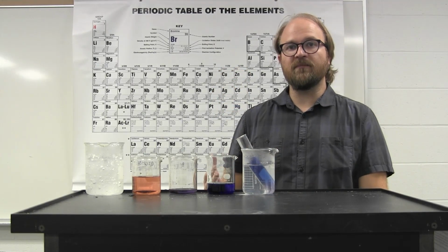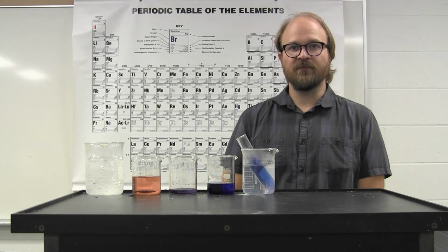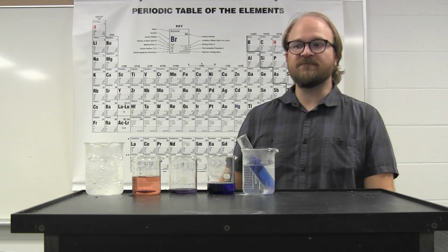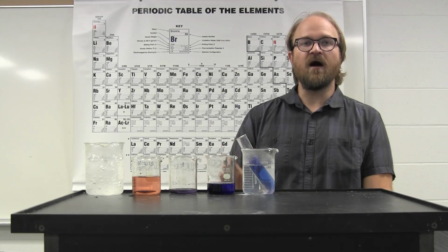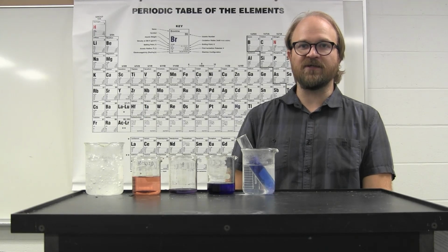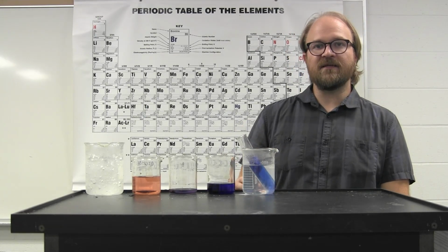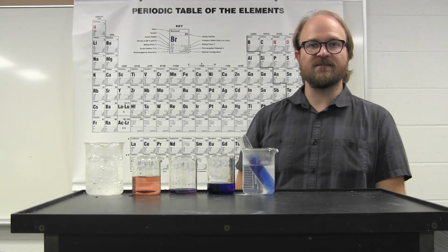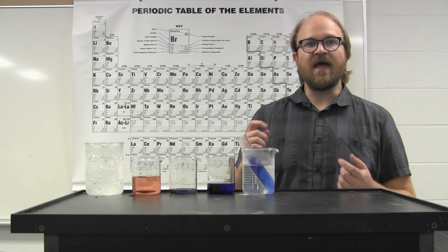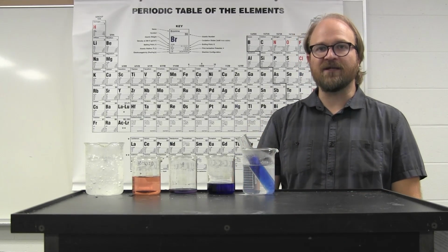This equilibrium shift can go back and forth depending on the temperature. And overall in this experiment, you're looking at the temperature dependence of this equilibrium reaction by looking at the equilibrium constant at 3 different temperatures and plotting this to figure out the enthalpy and entropy of this reaction.